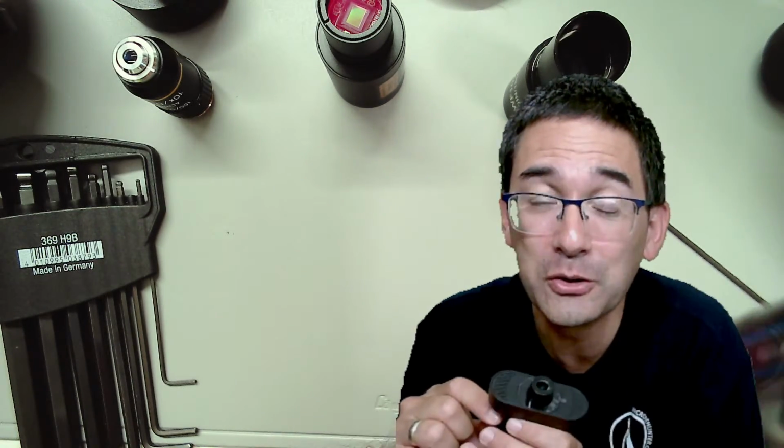That's also possible. This was actually one of the things that I tried about 20 years ago when webcams came up, and I only had my analog camera. I got myself a so-called surveillance camera module and took it apart. It was an analog television video camera, so no computers. I connected this directly to my VHS tape recorder and recorded videos directly on the VHS tape.